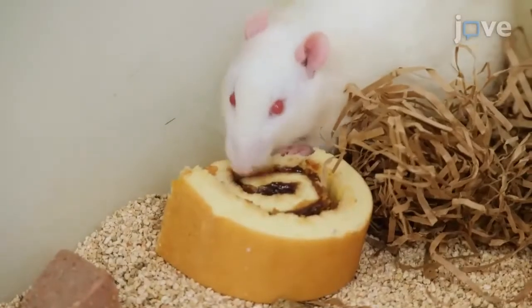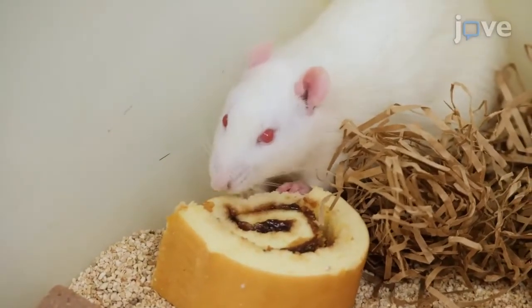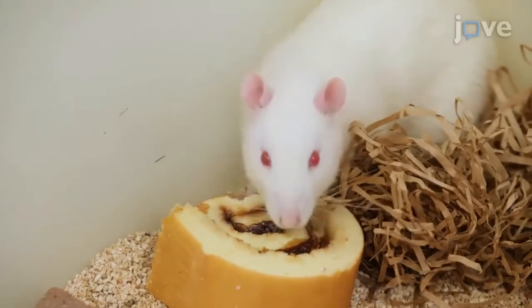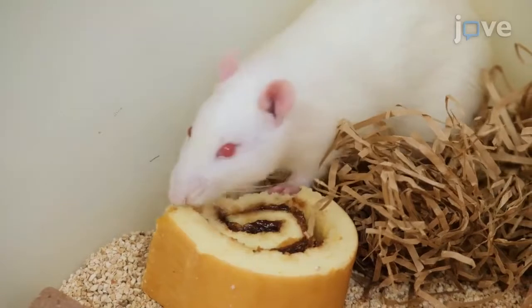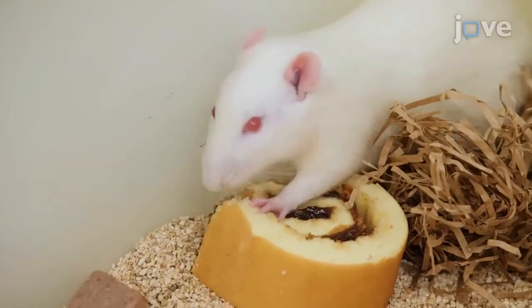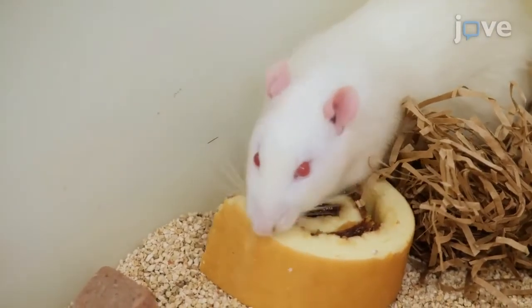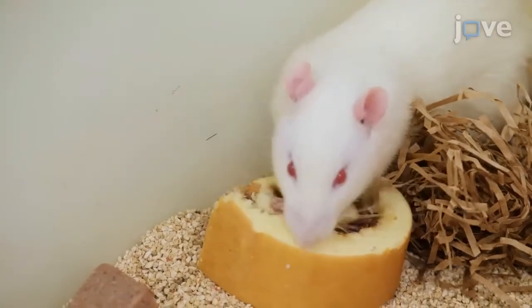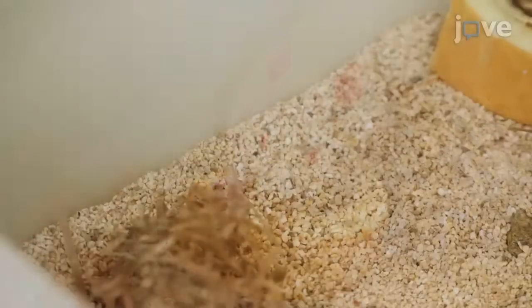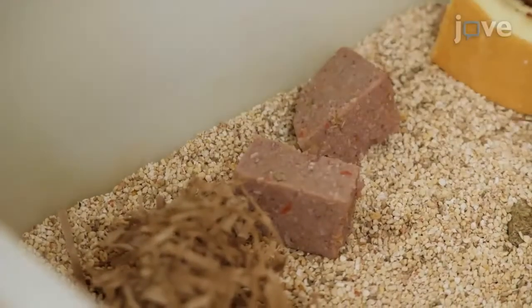As rats eat most of their daily intake in the initial portion of the dark cycle, schedule cafeteria food replenishment close to the onset of the dark schedule so that food is fresh at this time. Replenish cafeteria diet every day.